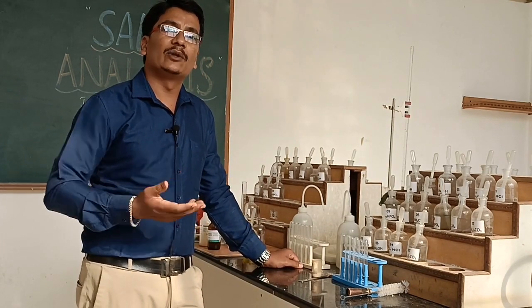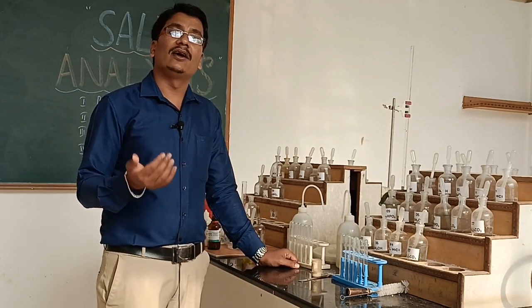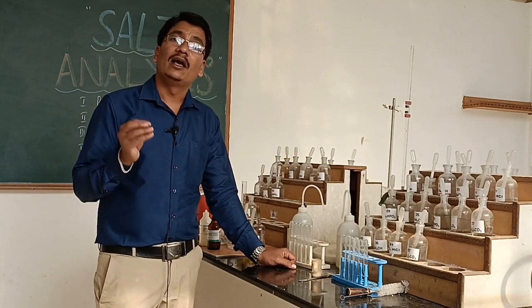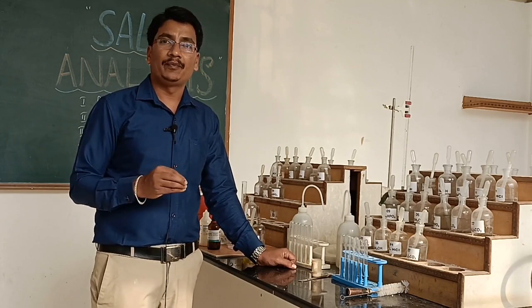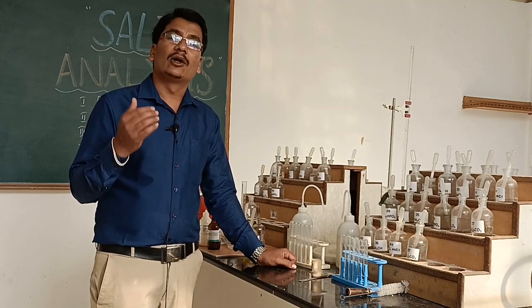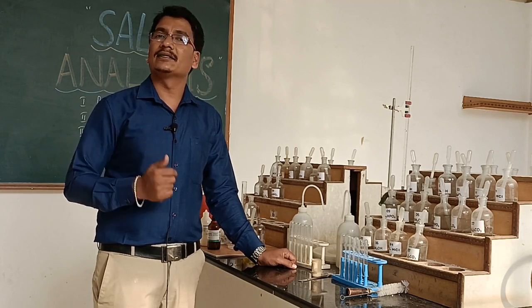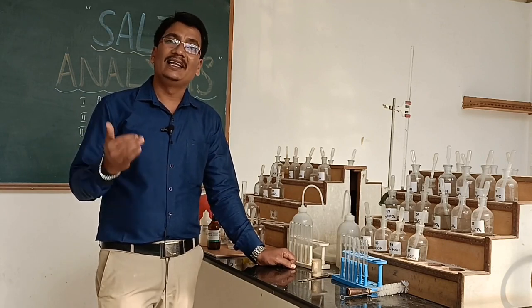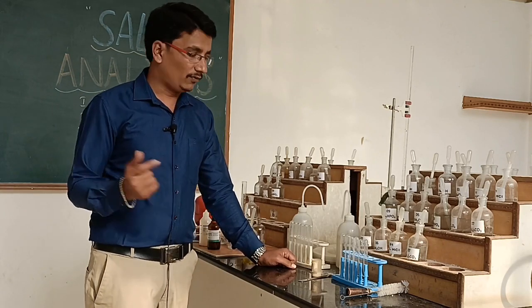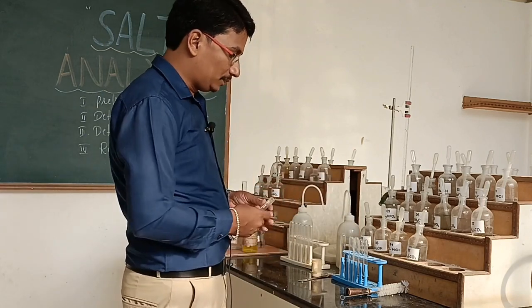The first group acid radicals contain the carbonate ion. The second group acid radicals include chloride, bromide, and nitrate anions. The third group contains the sulfate ion. First, I would like to start the detection of acid radicals.